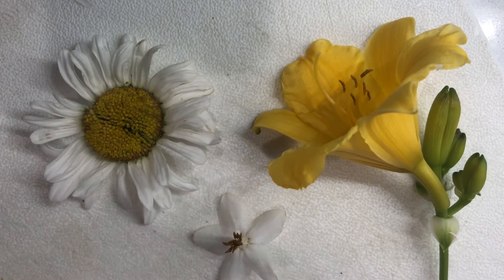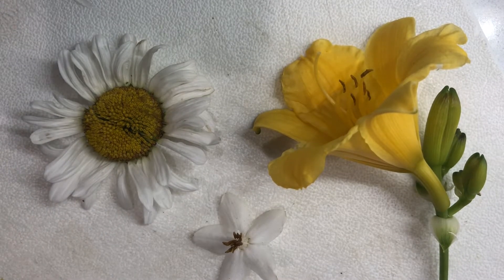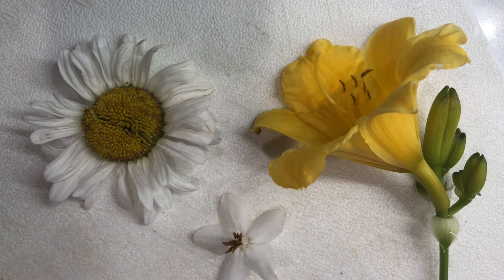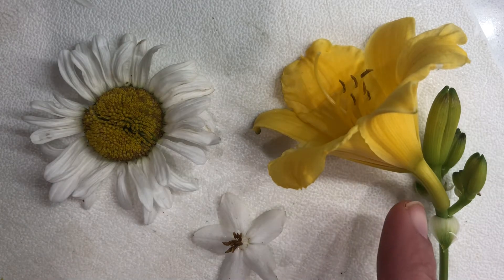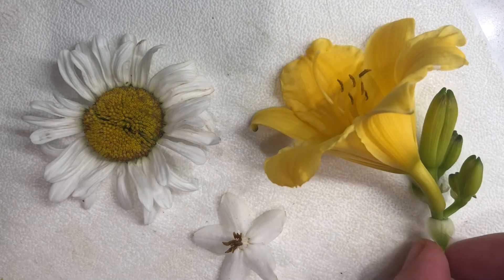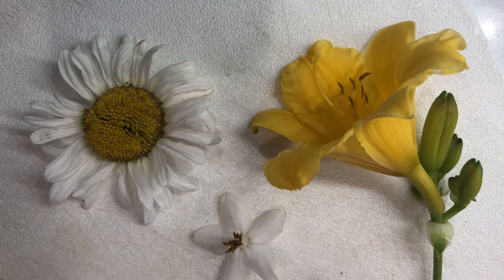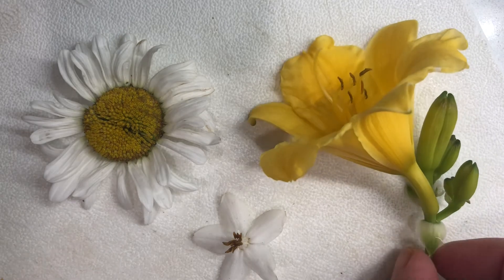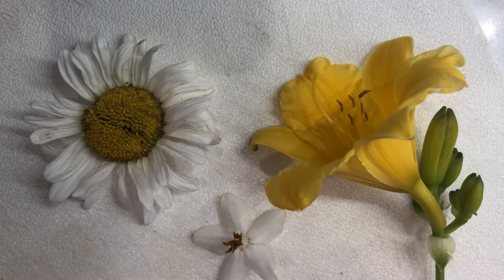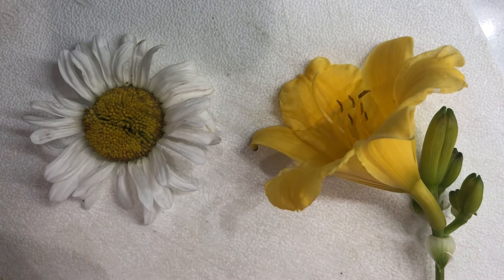Hi everybody! These are some flowers I got on a walk I just took, and we're going to start with this lily because it is a real simple flower for showing all the major parts. It has both male and female parts and so it's a nice example.